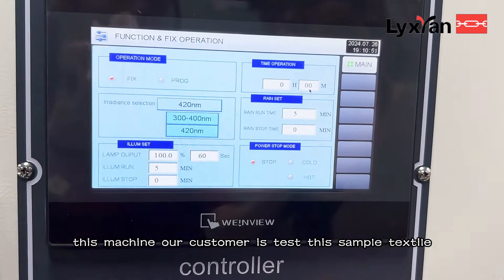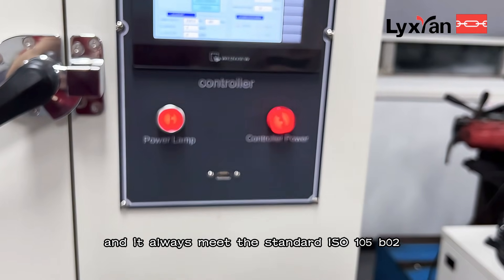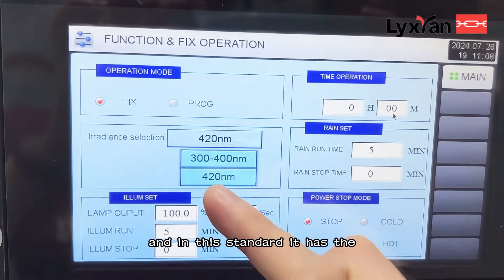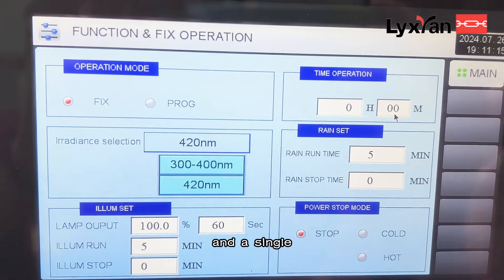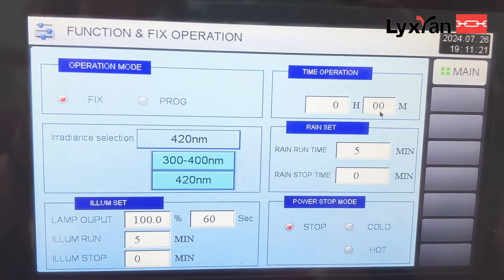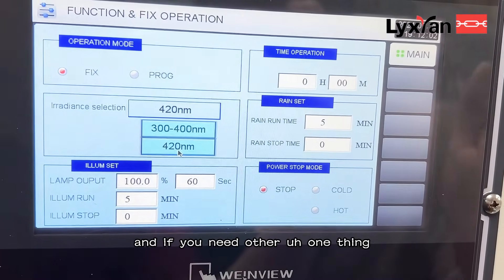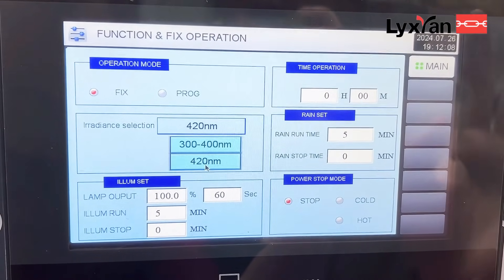About the function: our customers test textile samples, and this machine always meets the standard ISO 105 B02. In this standard, it has the wavelength range 300 to 400, and a single wavelength of 420. If you need this wavelength range you can choose here, and if you need 420 you can choose here. If you need another wavelength range, you can tell me and we can set it for you.